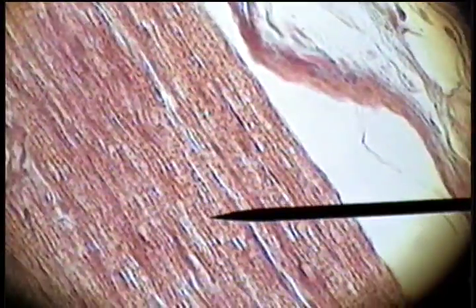If we scan along the longitudinal cut, we may see a constricted area where the myelin sheath dips in, and where the endoneurium tucks in at this point. This is called the node of Ranvier. Here is another node of Ranvier where the endoneurium is pinching in here and here — that is the node of Ranvier on the longitudinal section of the nerve.